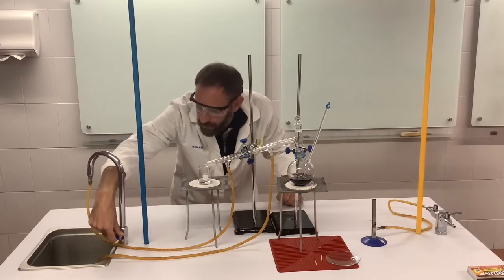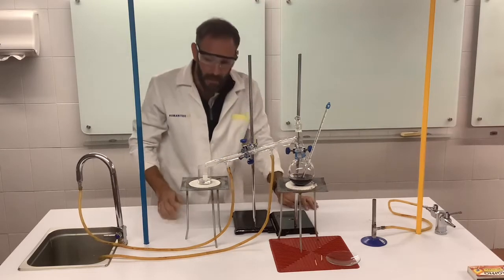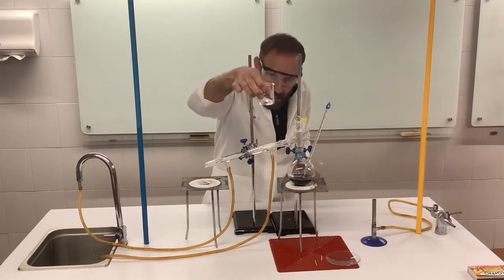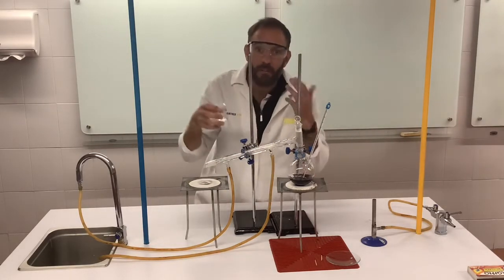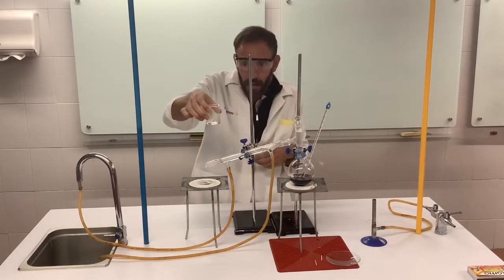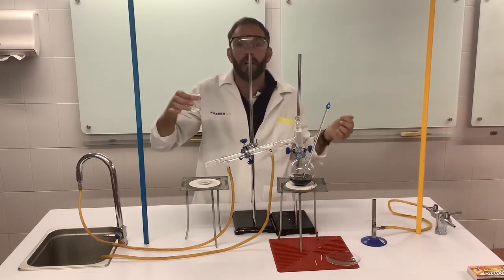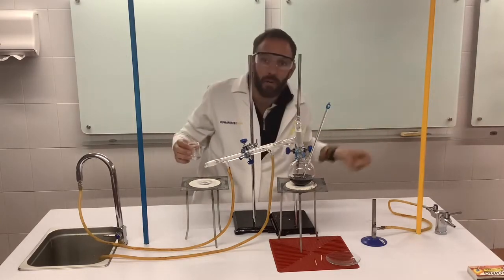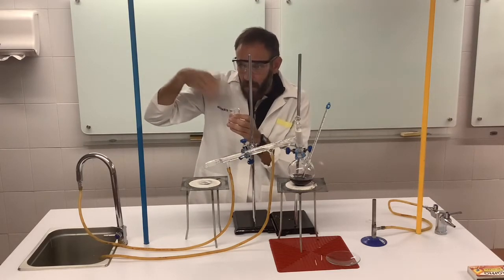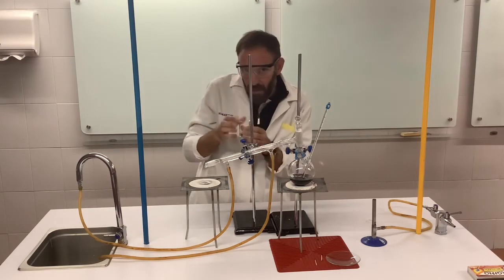Now I'm going to turn the tap off because I'm happy that we've collected enough, and also then you can hear me better. So here we go. So we've collected the ethanol there, the pure alcohol. There are 3 checks that we can do readily to check if it is in fact alcohol. First one is to smell it. Now remember, in the lab you should never smell liquids like that with your nose. You should just waft it towards you and take a gentle sniff. So I can smell the alcohol there. So that's my first clue that it's alcohol.